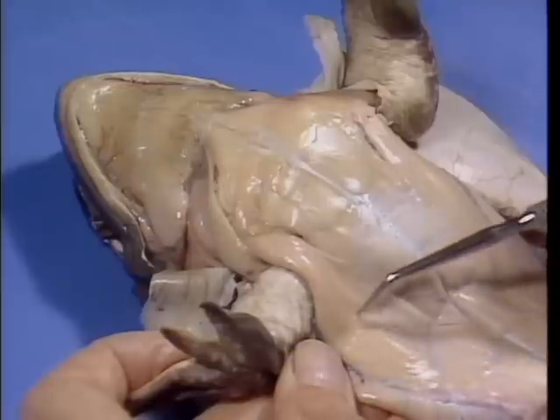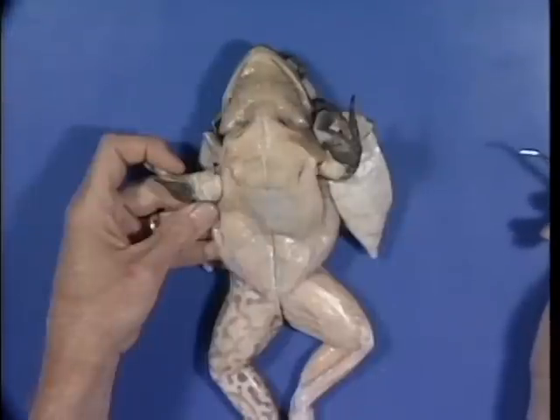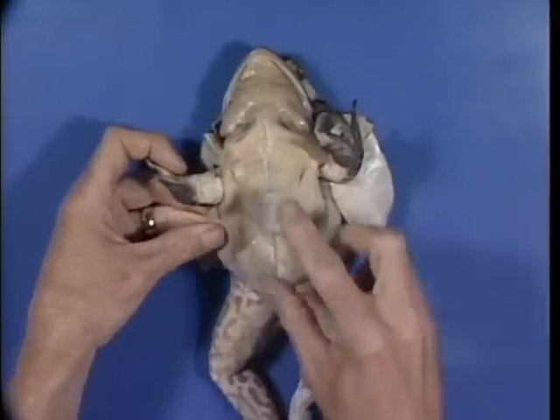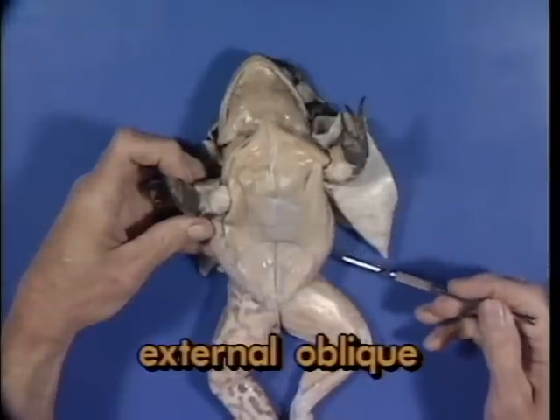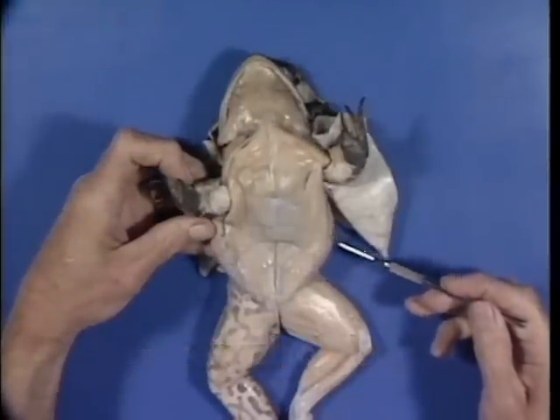Together they help flex the forearm and draw the upper arm closer to the body. This last movement is an example of adduction, which implies that the limb is being drawn in toward the midline. The body wall is covered with a sheet of muscle called the external oblique. It is quite thick and provides support and protection of lateral portions of the abdominal cavity.